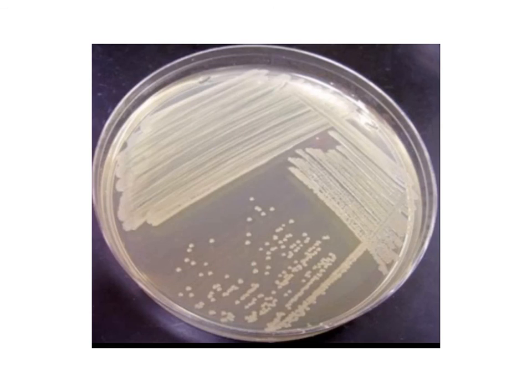When you have completed the lab, you always want to end the lab with sterilizing your equipment again, and then spray down your station with an antimicrobial spray, and make sure that your workstation is clean and ready for the next group.